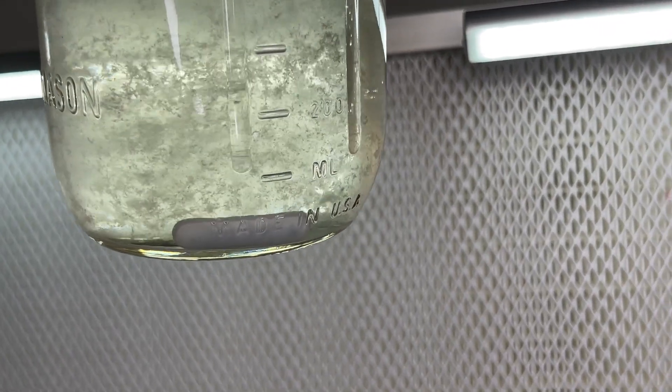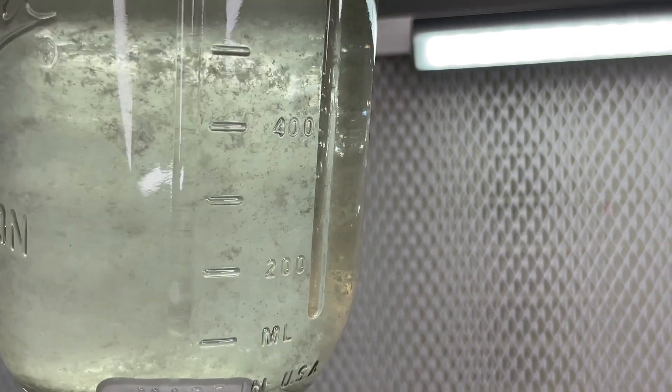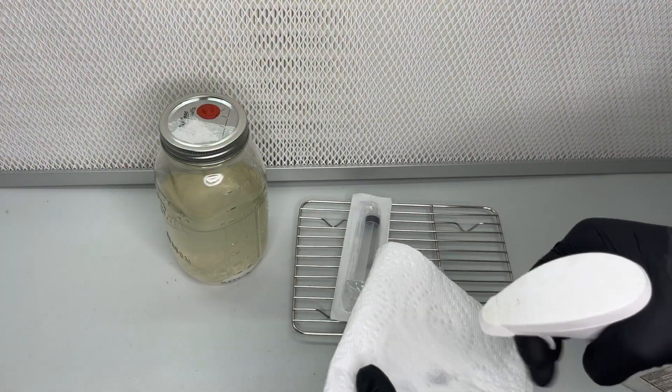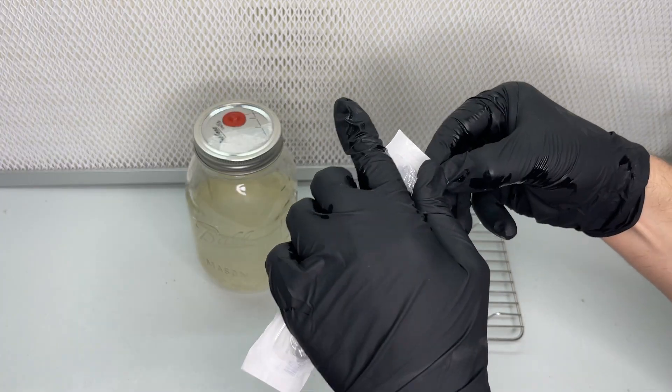After one more week the mycelium is now ready to be used and made into multiple syringes. Any extra mycelium that you don't use can be stored in the refrigerator for over 12 months.